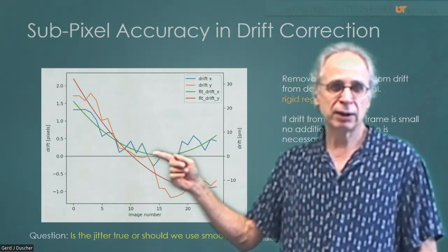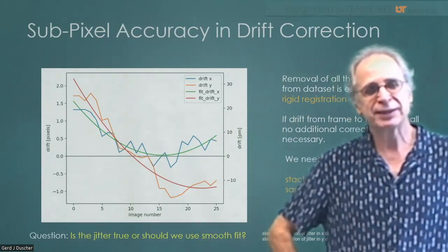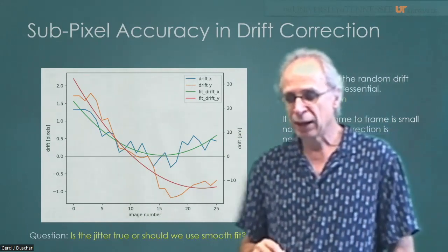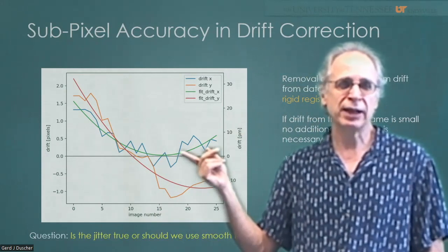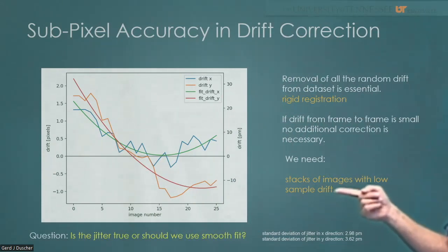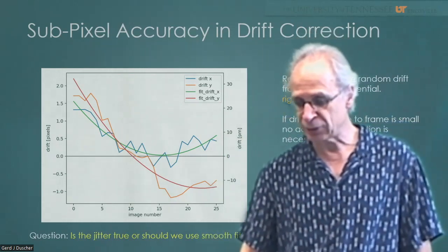I did this rigid registration with sub-pixel accuracy, and we will see that this is actually a complete overkill, and the less you do to your data, the closer you are to the original, the better it is. So, do you have to correct that? The answer is yes. You do actually have to correct that in order to improve your quantification. So we need stacks of images with low sample drift. Low is relative, but it shouldn't be more than 1 or 2 pixels per frame. In the ideal case, of course, even less.